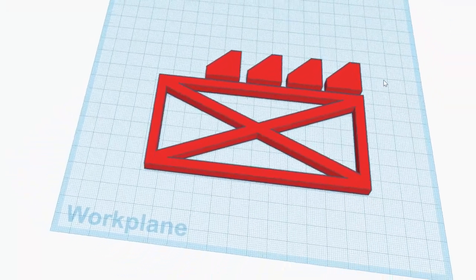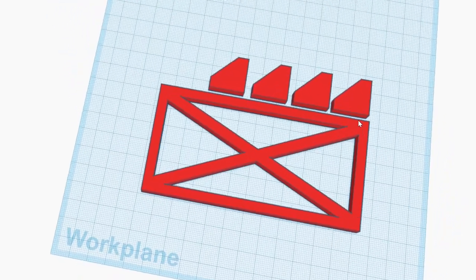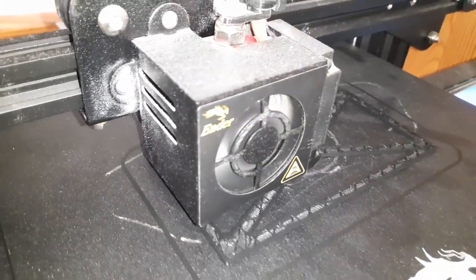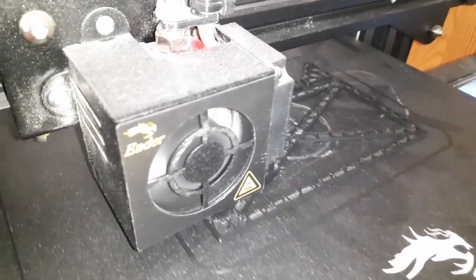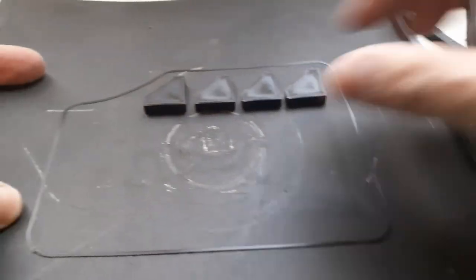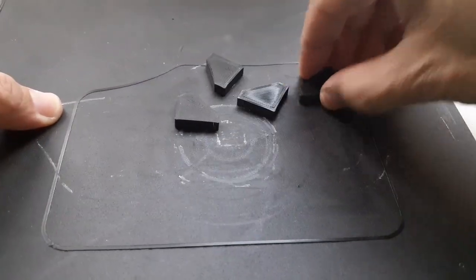So I designed the rack in a free online program called Tinkercad. And I decided to print the four legs separately for stability purposes, and also to reduce the printing time a little bit. But the printing still took over an hour. Here it is. I simply designed it without really much premeditation. I simply made it as simple as possible and as quick as possible.